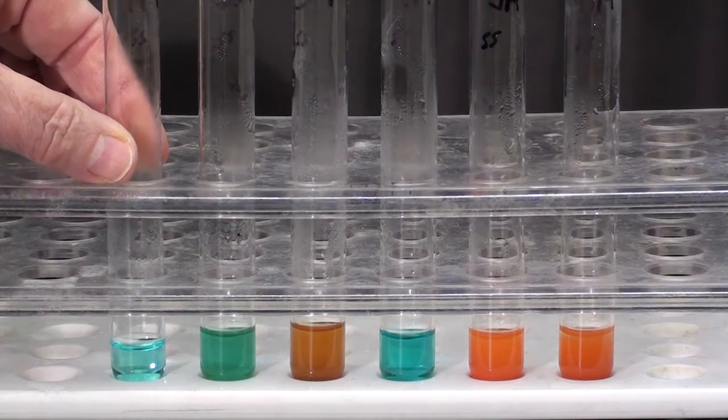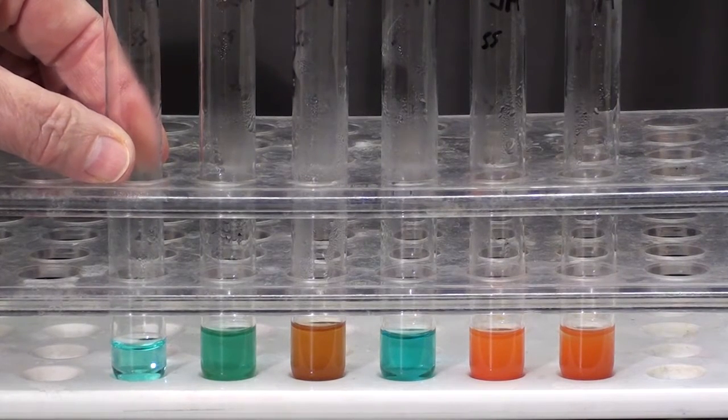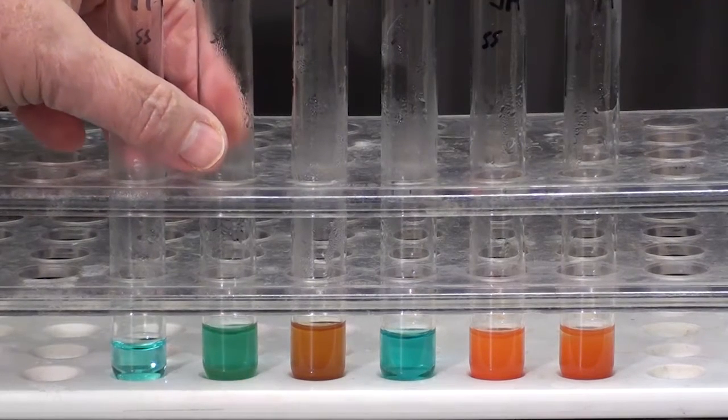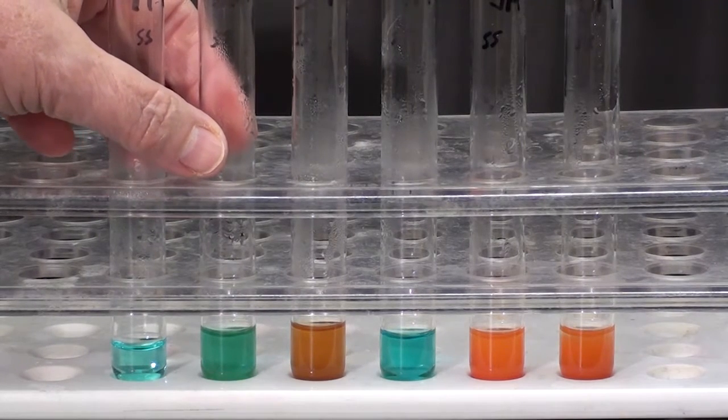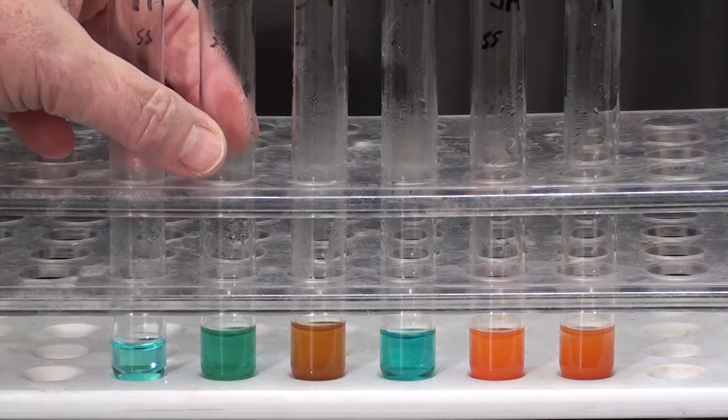So this was boiled with Benedict's and no sugar was present. Test tube two contained starch and water. It was placed at body temperature for 30 minutes.